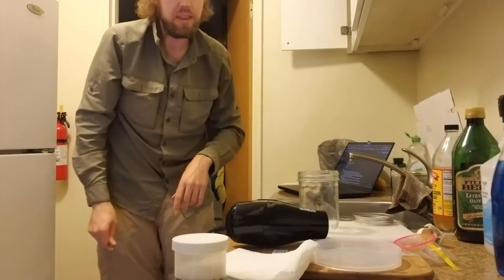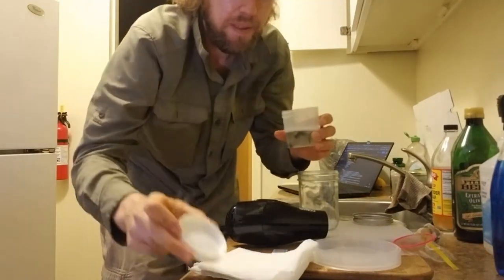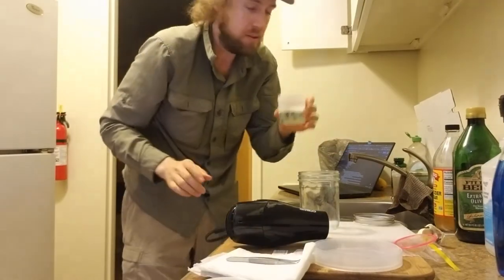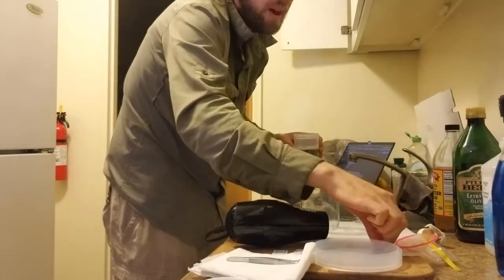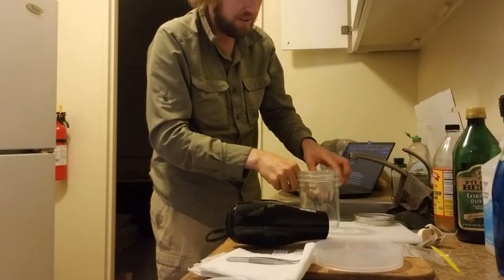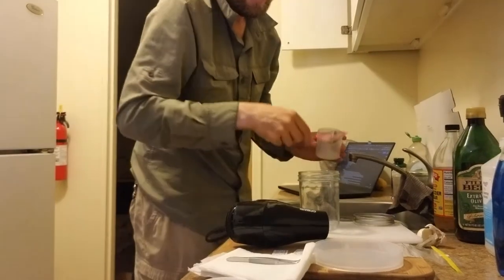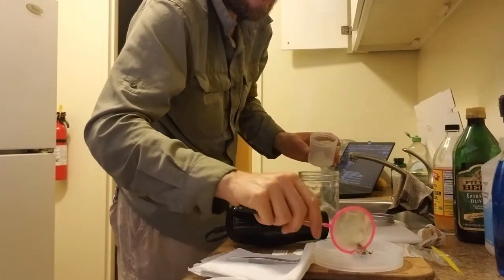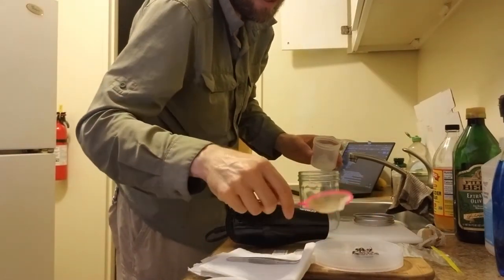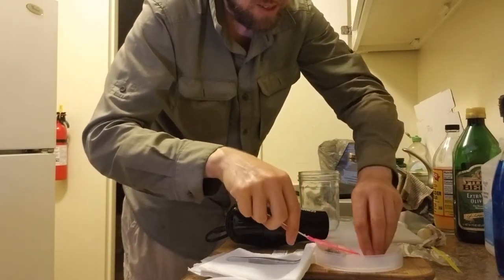In some cases you might want to use a dissecting scope to help you sort out some of your specimens, but the first thing I'm going to do is pick out all the bees from my batch of specimens here. I'll use my brine shrimp net just to sieve it out and get most of the water out, and I'll put them down. It's all covered in suds so that makes it kind of hard, so I'm going to rinse the suds off.